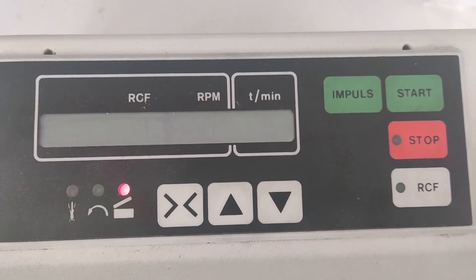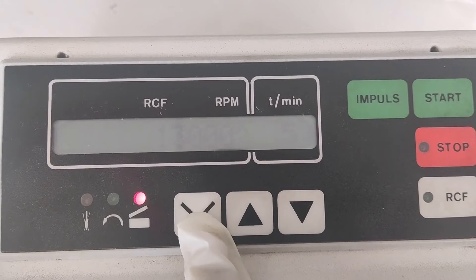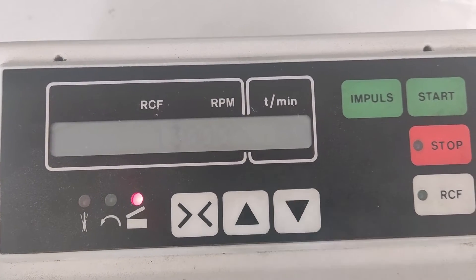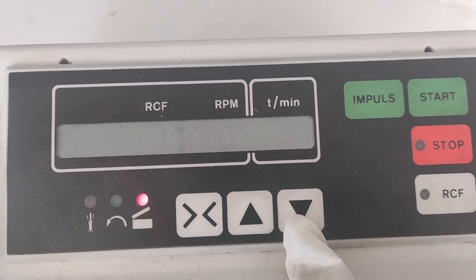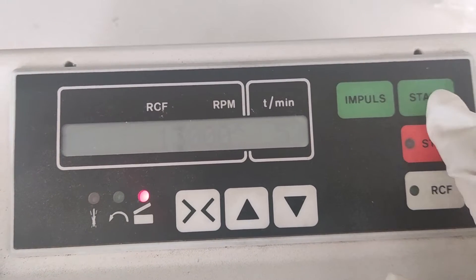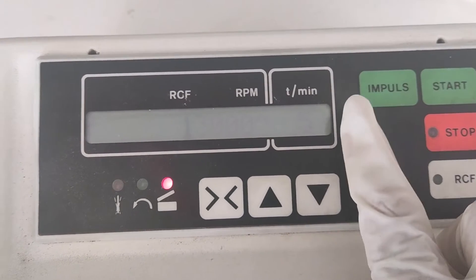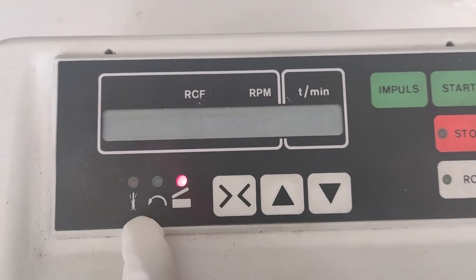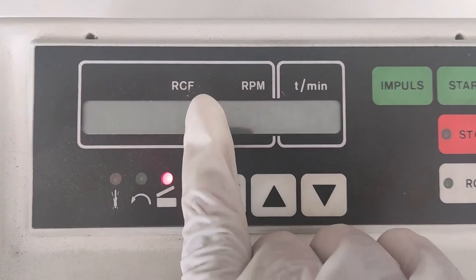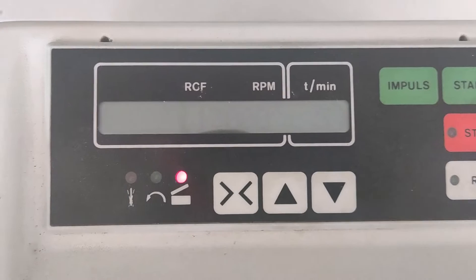There are many controls and display elements. The first one is the selector for selecting individual parameters. There are arrow up and down buttons to change the value, a start button, a stop button, an RCF button, an impulse button, three indicators, and a display to show the RPM and the time in minutes.